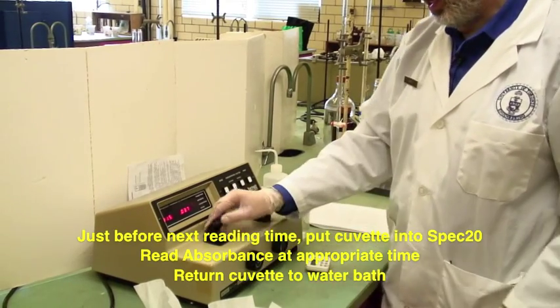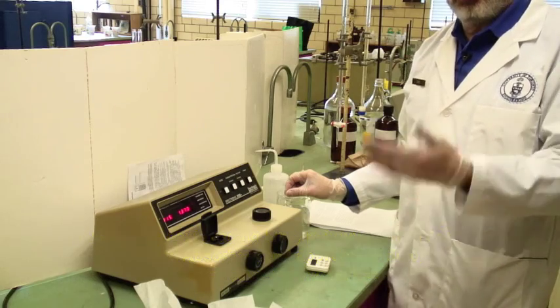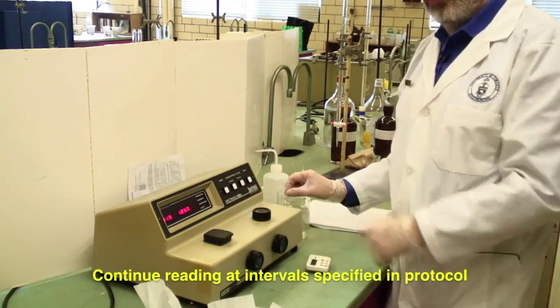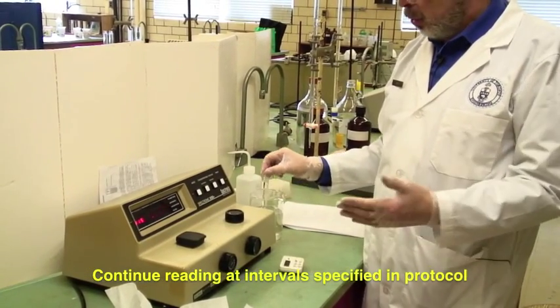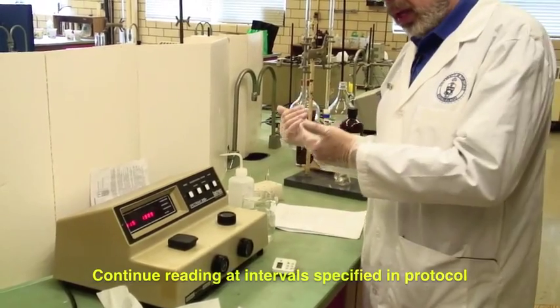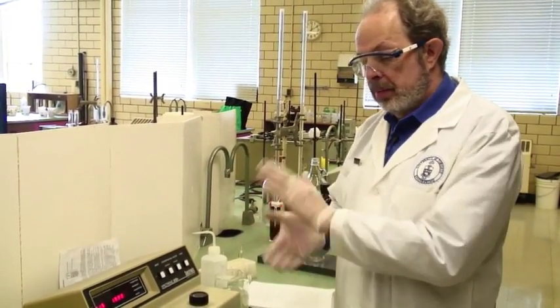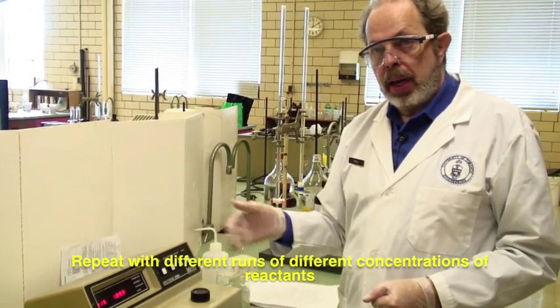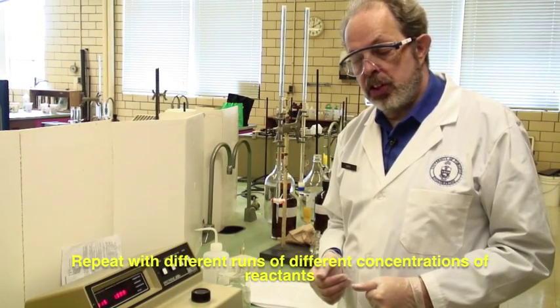Read 0.38. Take this out and hold it. Continue until you have reached the end of the appropriate time span. Then you will take a second set of chemicals and again mix them for T equals 0, read initially, and continue to read at the appropriate timed intervals.